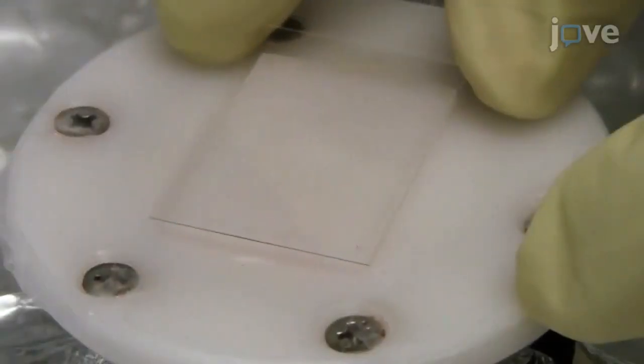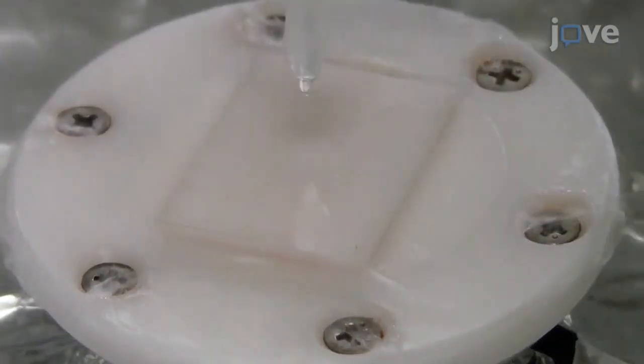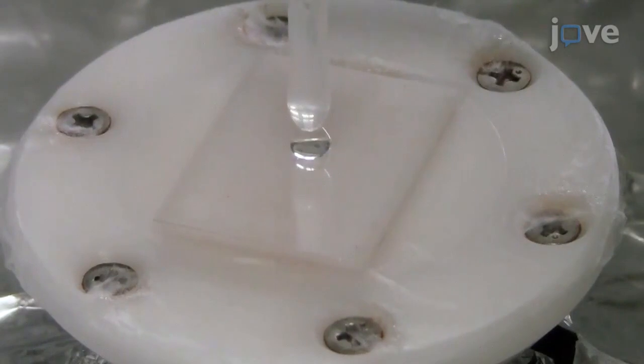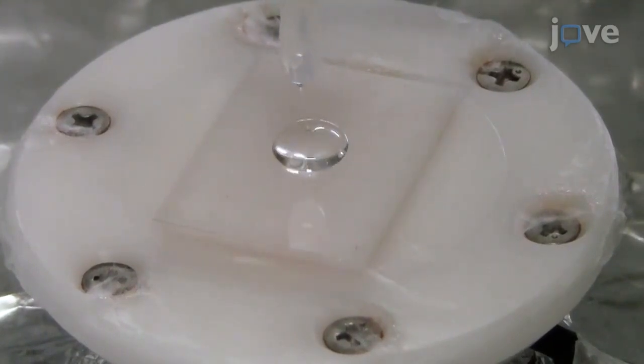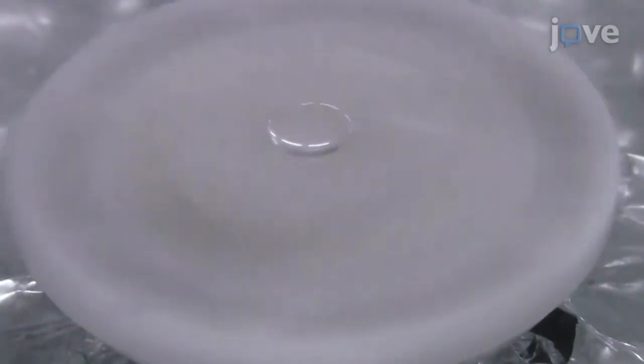Place the glass substrate on the customized vacuum chuck for the spin coater. Dispense 70 to 90 microliters of type A CYTOP polymer at the center of the glass substrate. Then immediately spin coat the polymer.